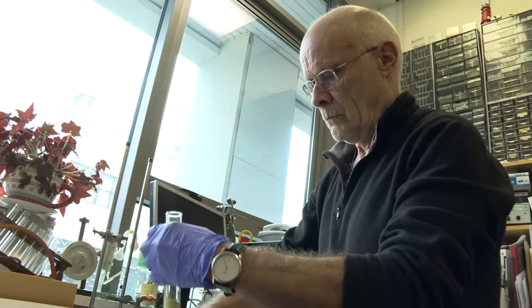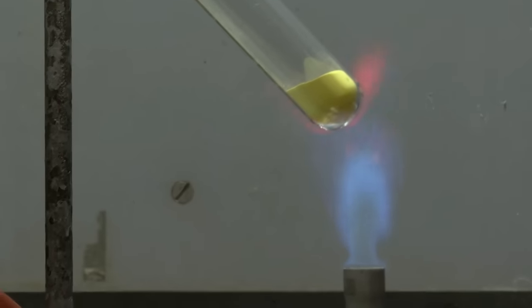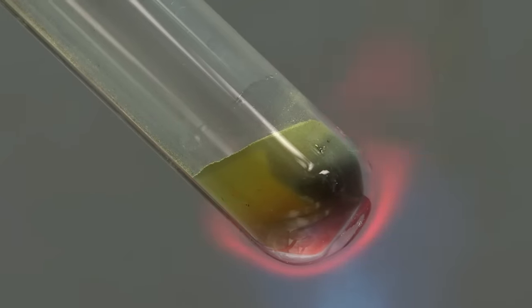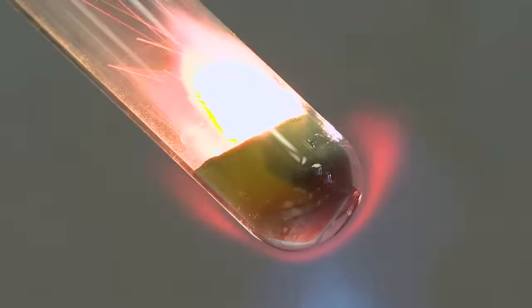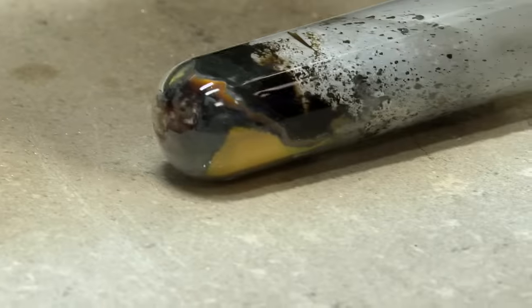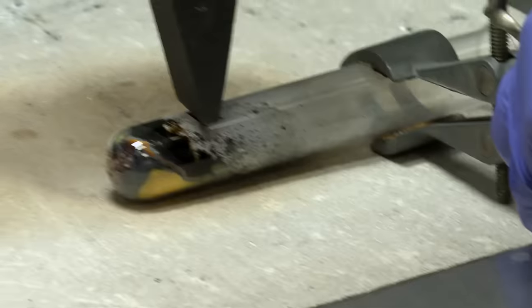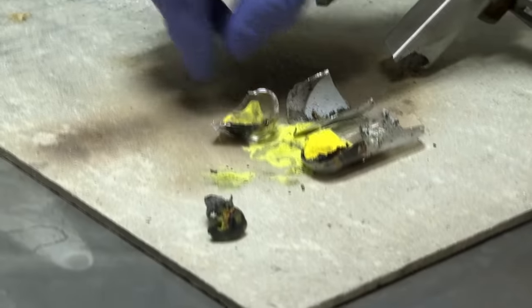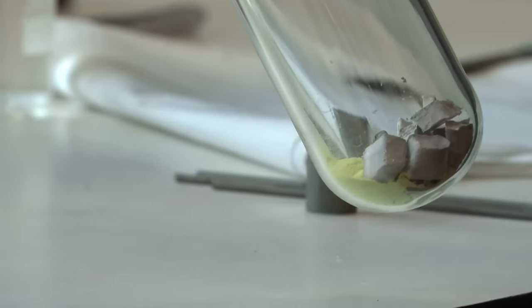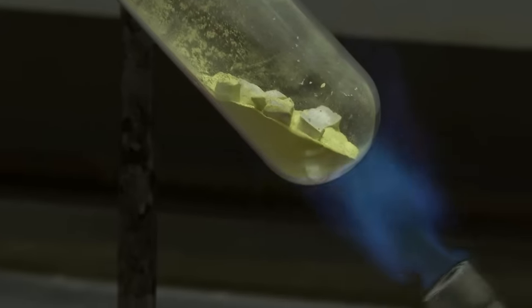So we put the sodium underneath the oxide. There was again a flame. And possibly the oxide had got a bit yellower. But then Neil got a bigger tube and thought we would make it work.